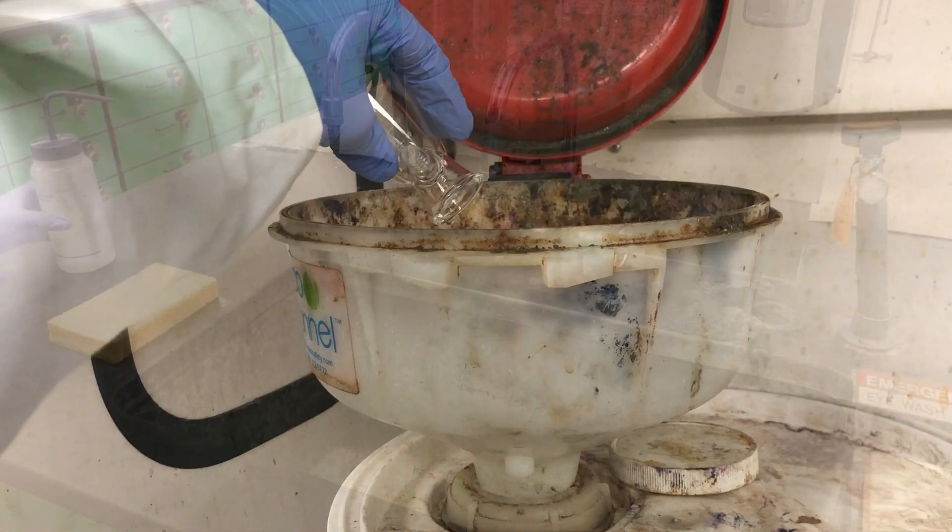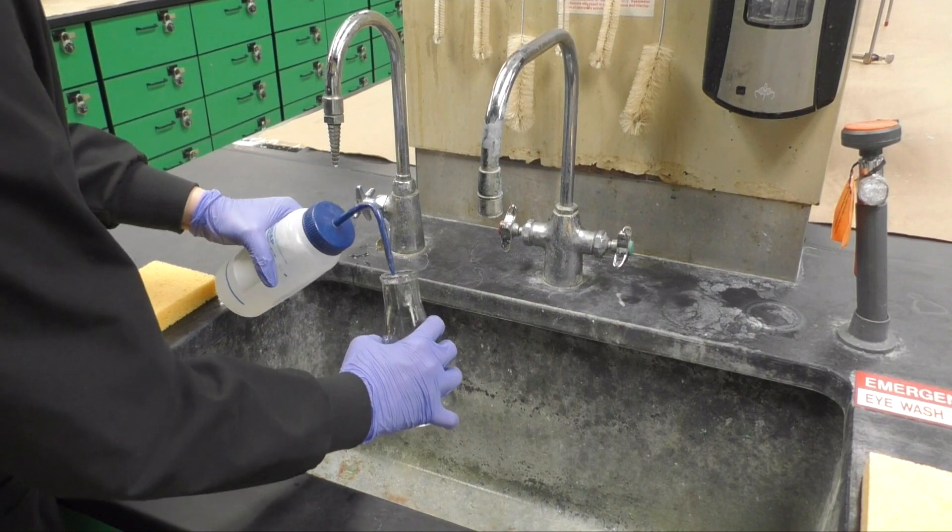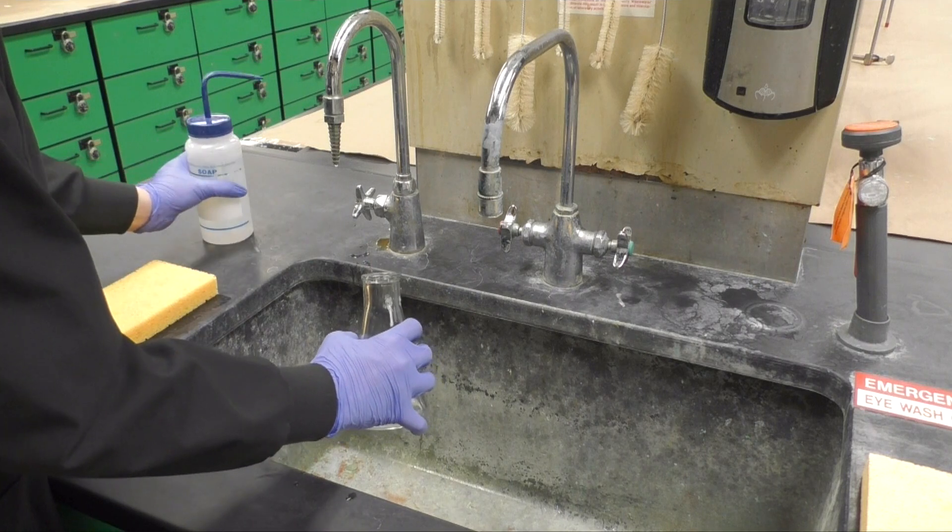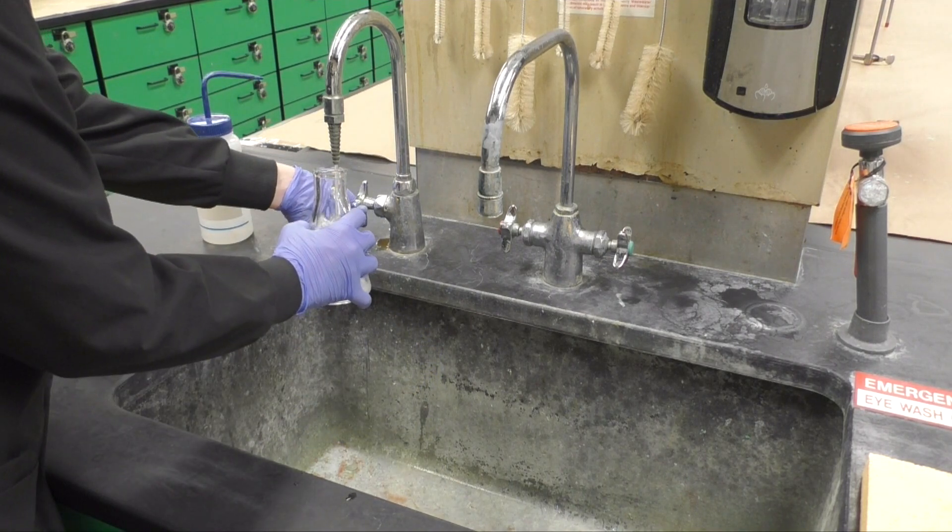When finished, dump your filtrate into the liquid waste bucket and thoroughly clean your Hirsch funnel and filter flask. When done, return it to the student assistant in the prep room before you leave.